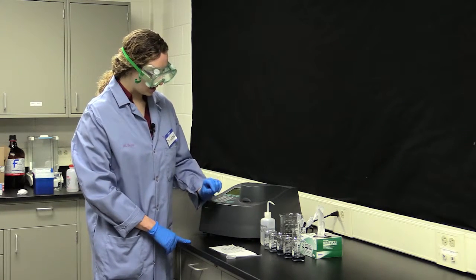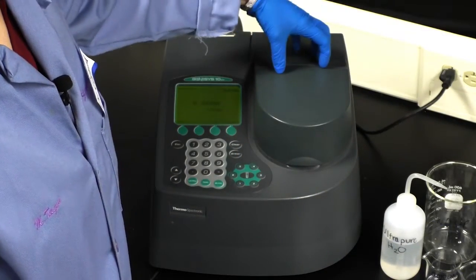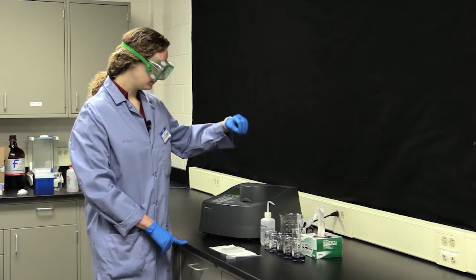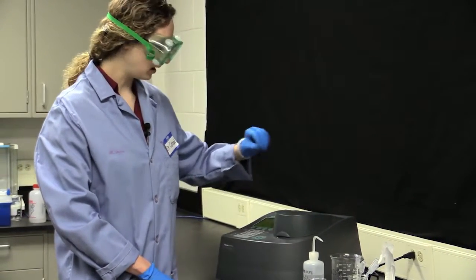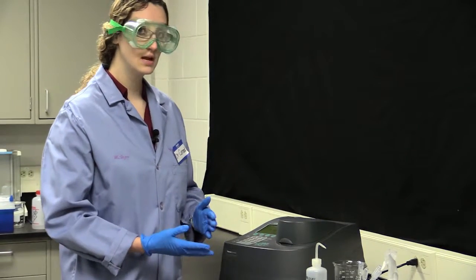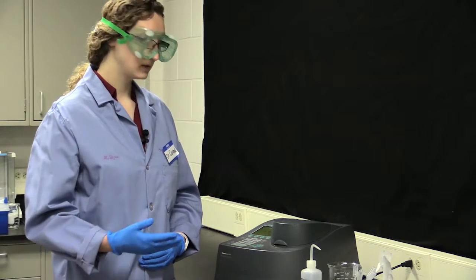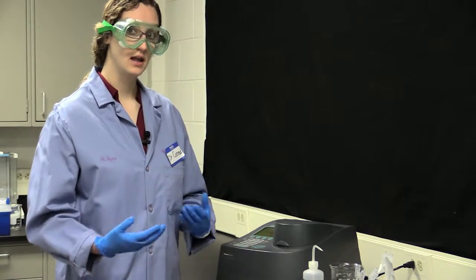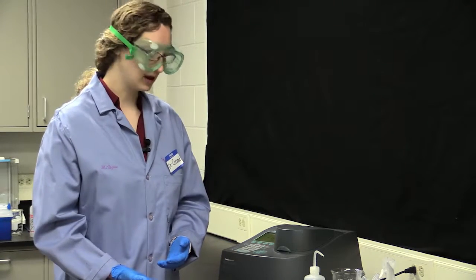First, though, a little bit of basics about the instrument we will be using today. This is what is called a spectrophotometer. What you're going to be studying is the absorbance of light in your chromium solutions, in which a lamp, your light source, will pass through your sample. We're going to measure how much light is transmitted, and therefore we can determine how much is absorbed by your sample with a detector at the other end.